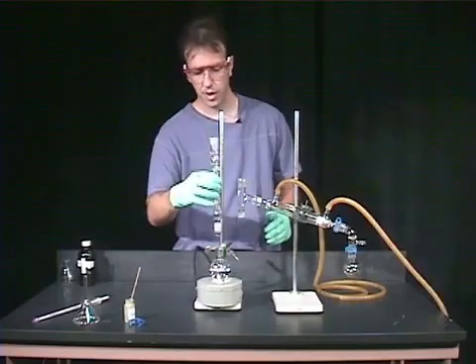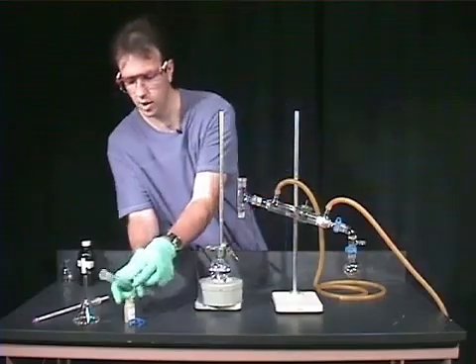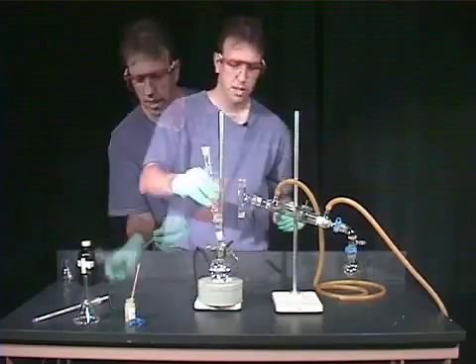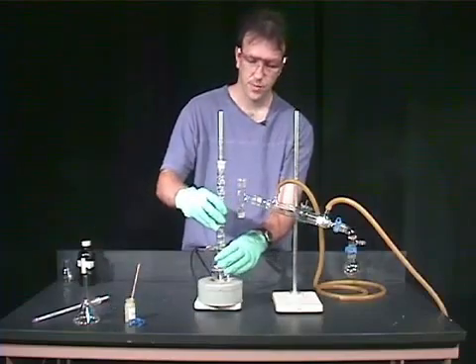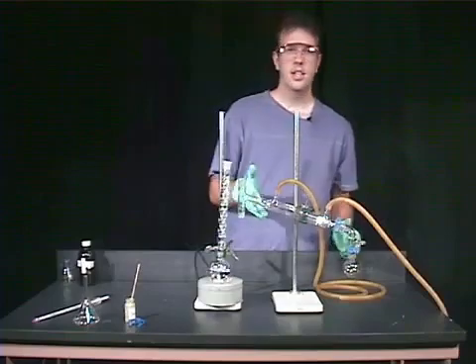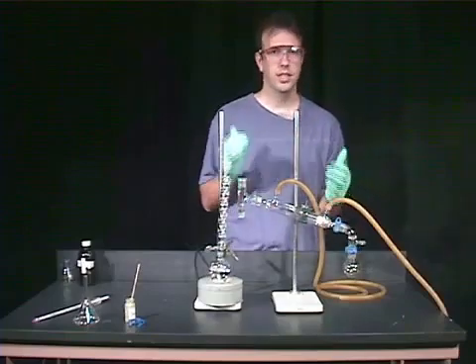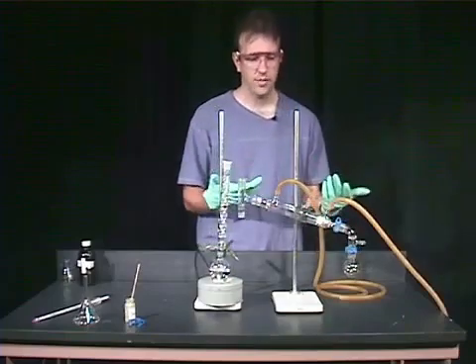So you basically would put this there. We have to grease the joint. So I'm going to add a little bit of grease, put that in there and spin that around. Got a nice seal there. And that's the only difference between a simple distillation and a fractional distillation.